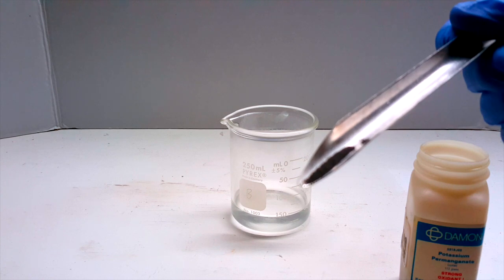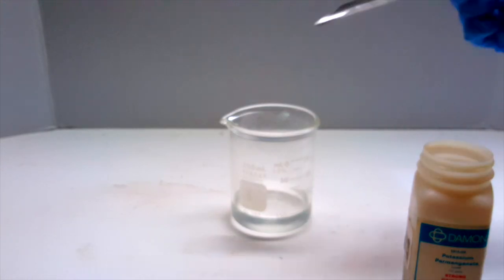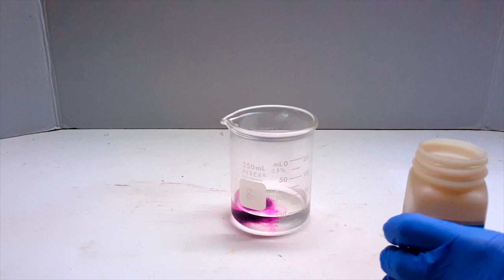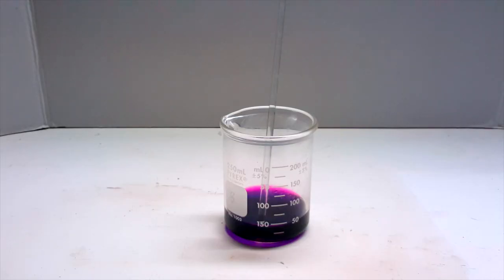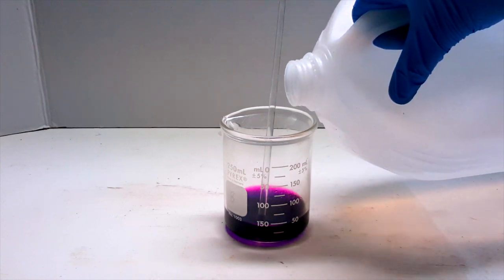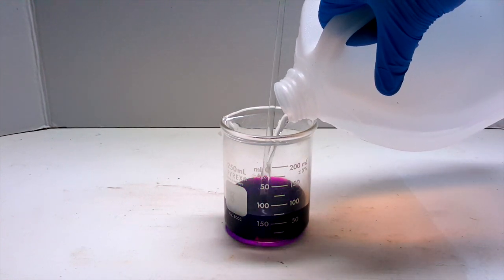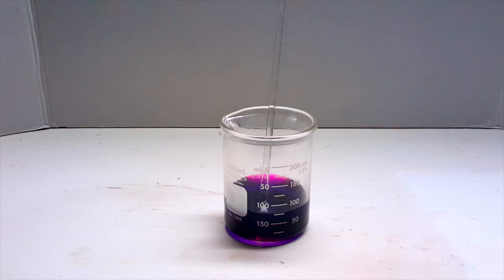In hindsight, the amount I used here was actually way too much. It ended up being super dark and concentrated, which makes the color change less evident. I noticed this mistake as everything dissolved, so I attempted to dilute it in another 25 ml of water. This didn't really help in the end, though.